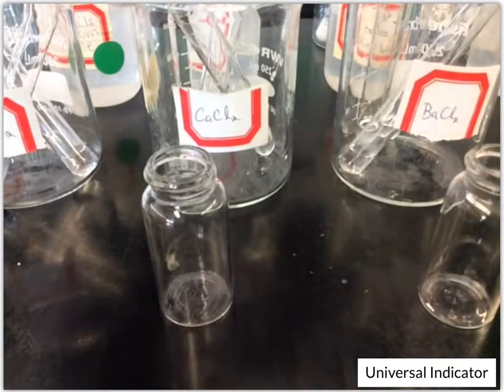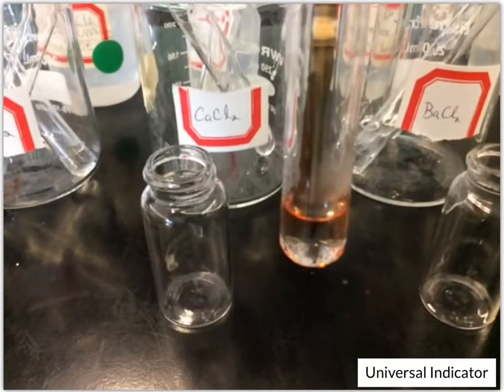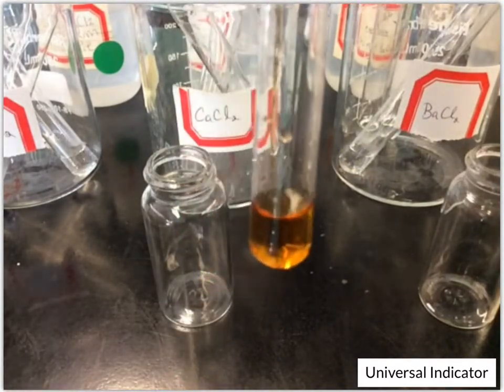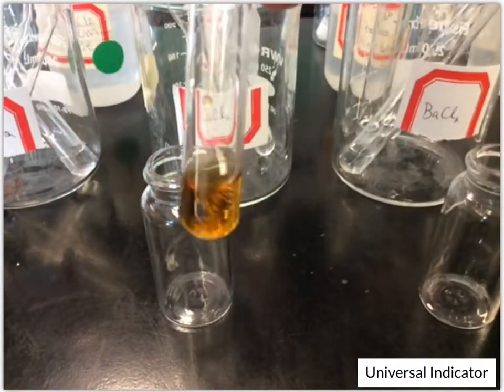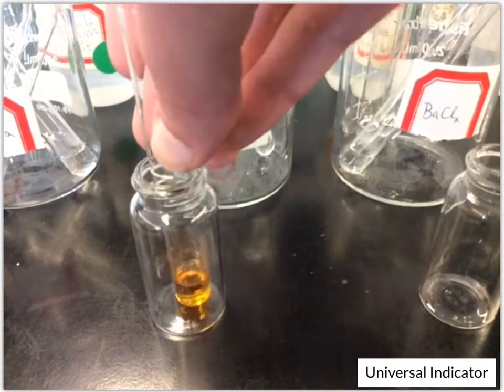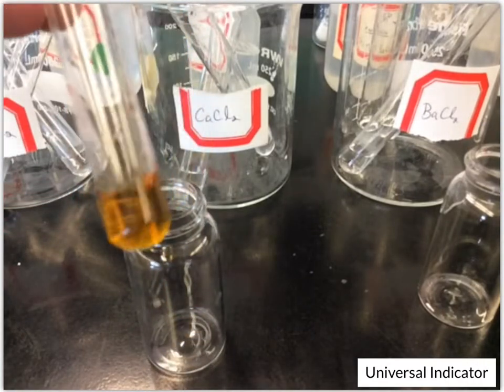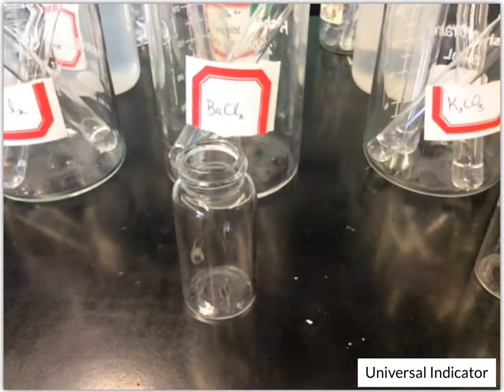Then next up, calcium chloride. This one actually looks a little bit lighter than the other two, and so we had that dark orange and we have this light, almost yellowish. It's more of a yellow orange than your potassium chloride and your magnesium chloride, which were darker oranges. So this one's more of a yellow, I would say. Yeah, even after giving it a minute, it looks kind of yellow. Okay, next up we have barium chloride.